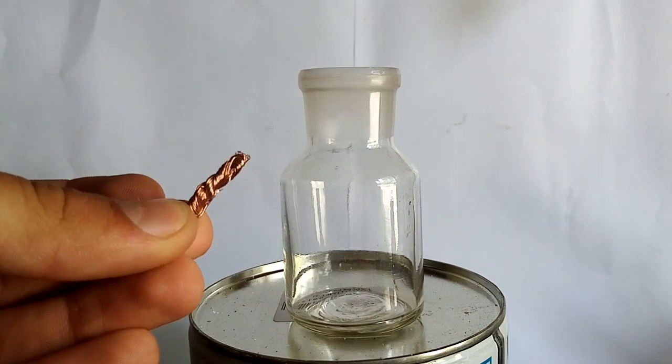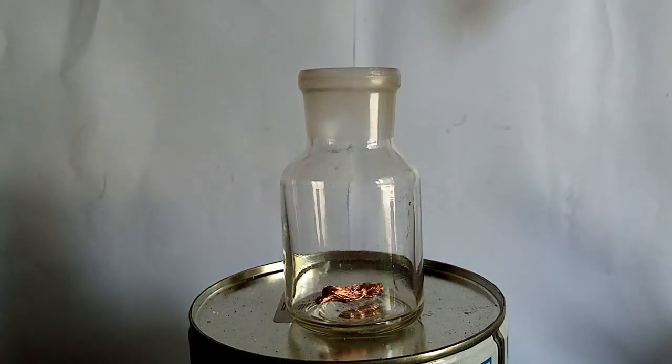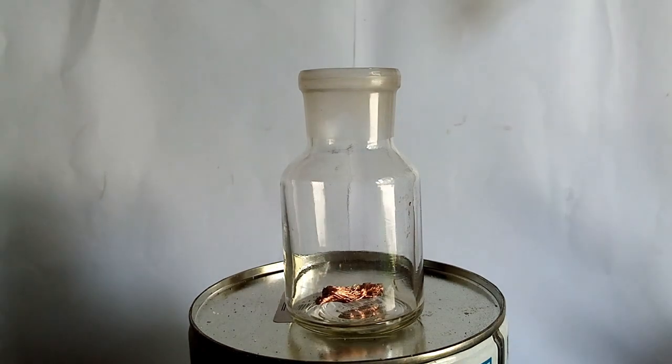To really see if I made nitric acid, I will test it using a copper wire where I put some acid on it.